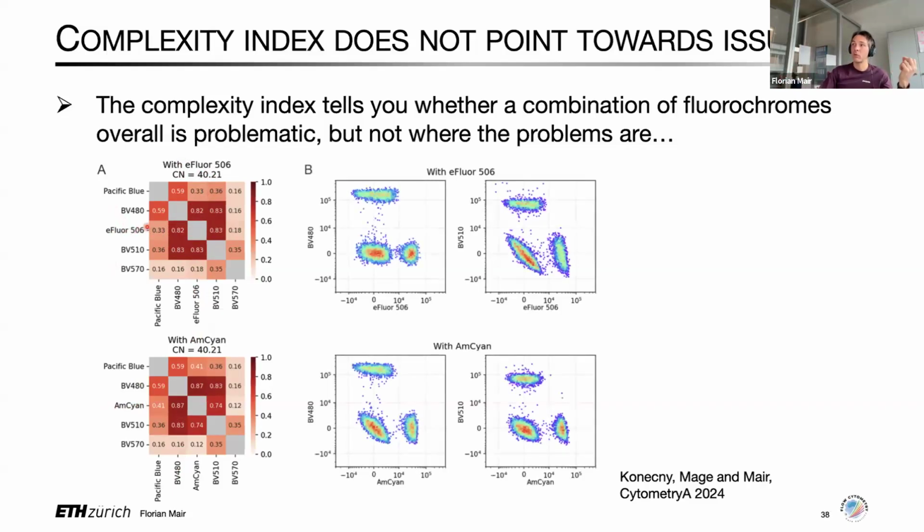But if you look at the raw data and plot it, you can immediately appreciate that with eFluor 506 and BV510, you actually have less resolution than you have with the alternative. You also have more tilting of the negatives. And more importantly, you actually have less resolution for BV510, that neighboring fluorochrome, than you do with the alternative, which is kind of counterintuitive based on looking at that. Or at least you wouldn't be able to tell that just by looking at the condition number.